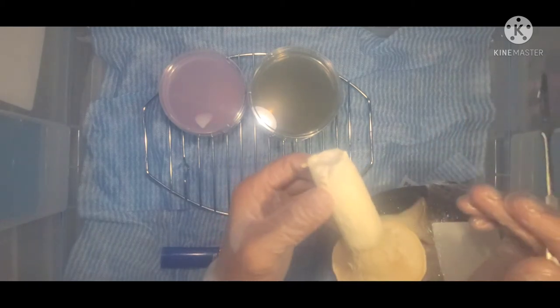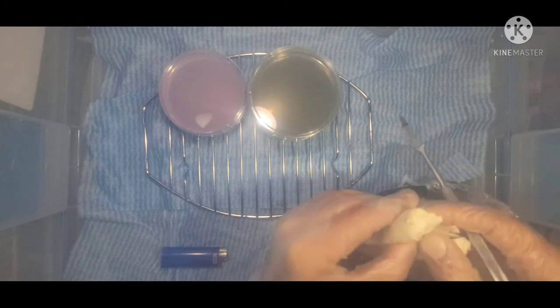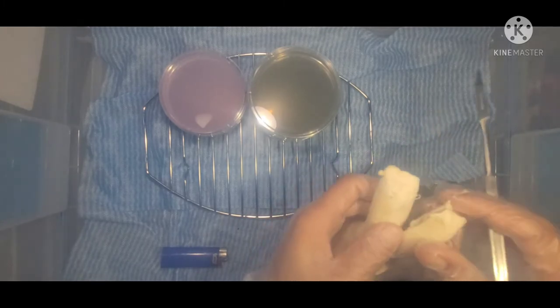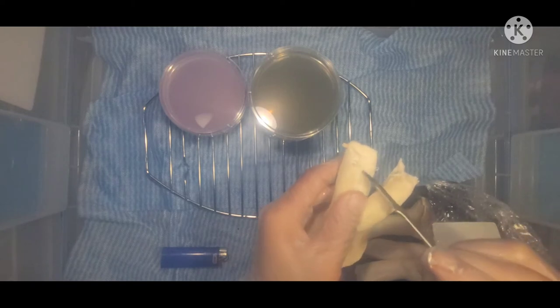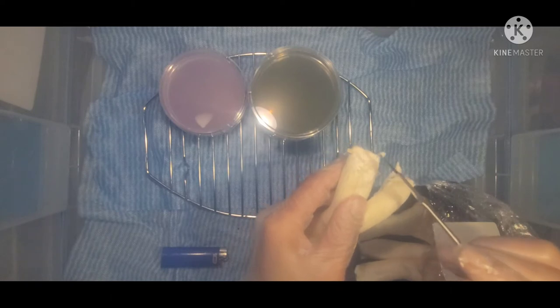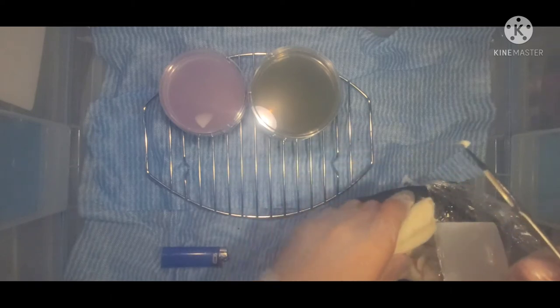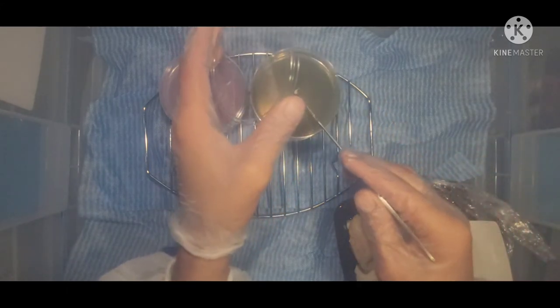We'll take this fruiting body of the mushroom - you can clone from the stem or from the cap - and we'll bust that open and cut a little tissue sample. It really doesn't take much at all, just get a little piece out. What's cool about working with agar is you can see the contamination, so if this is dirty or I mess up and contaminate it, I can isolate that.